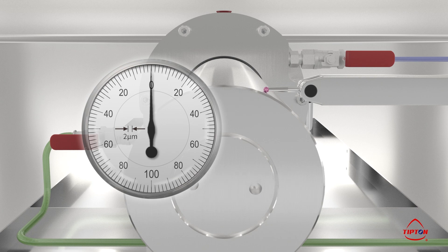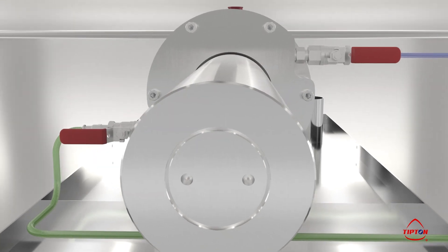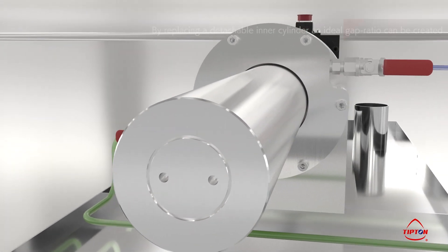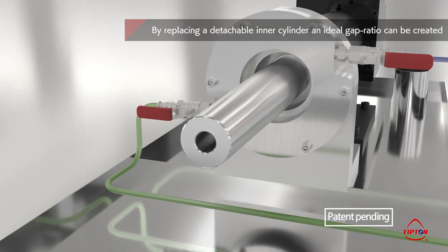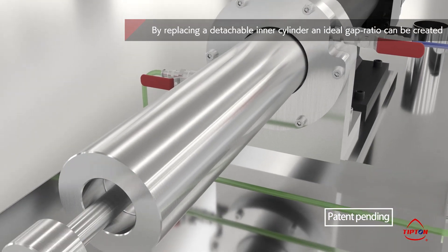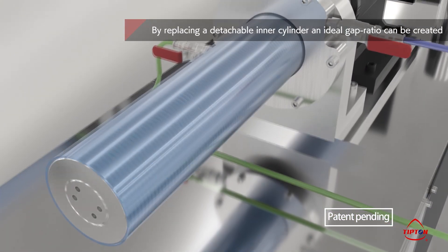Also, the inner cylinder can easily be replaced. Shearing force and production volume can be adjusted by replacing the inner cylinder with a different thickness and changing the gap width.